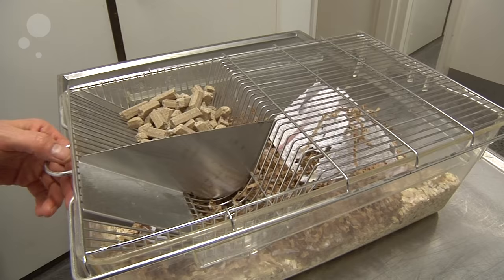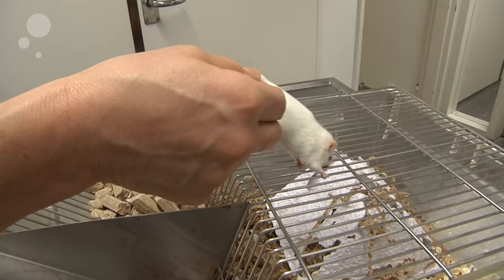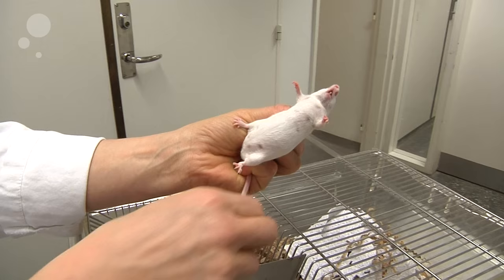For the Intraperitoneal Injection, you will again remove the mouse from the cage by grabbing her by the tail, lifting her up and placing her on the cage lid. You will scruff her and turn her about.